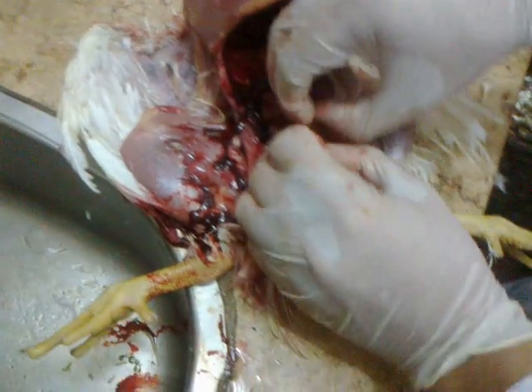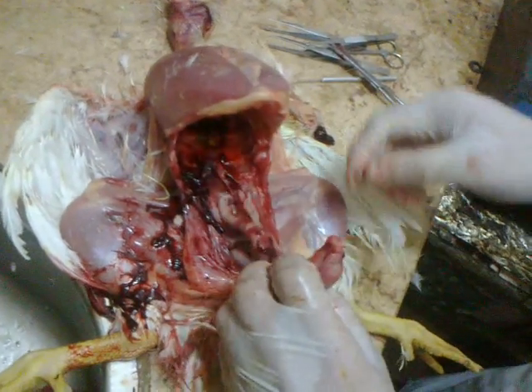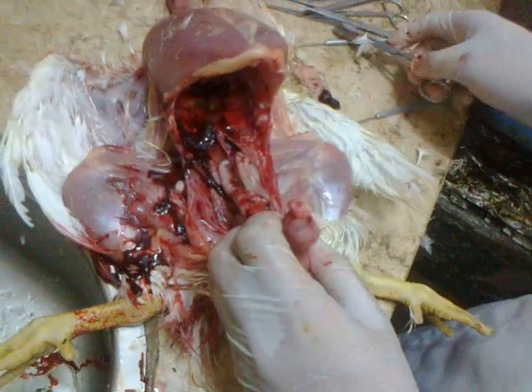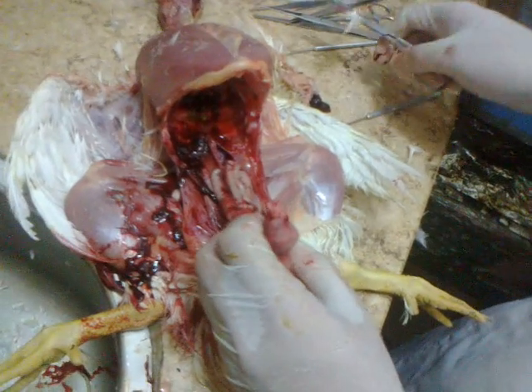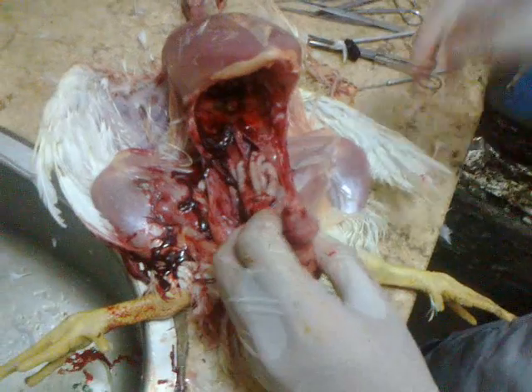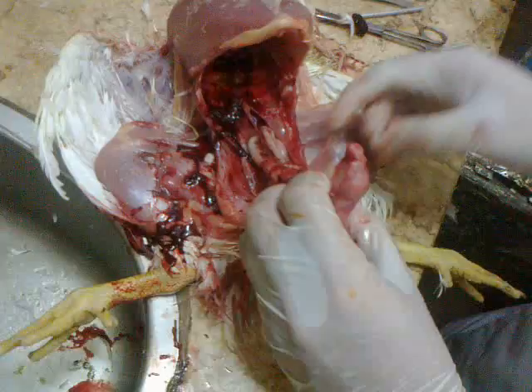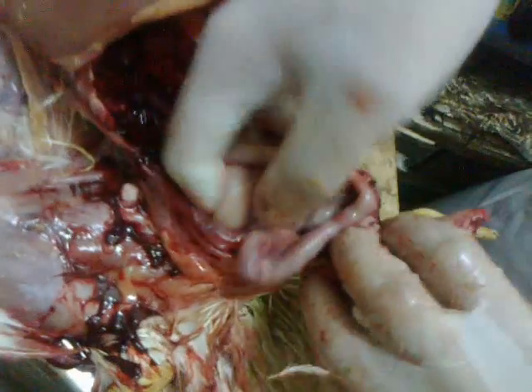This is the spleen. The spleen is very important when comparing its size to the bursa of Fabricius at younger ages. Under 20 days, the bursa is bigger than the spleen. From 20 to 28–30 days, they are both equal in size. After 30 days, the bursa is normally atrophied and becomes smaller than the spleen. We compare the bursa to the spleen as a compact organ.